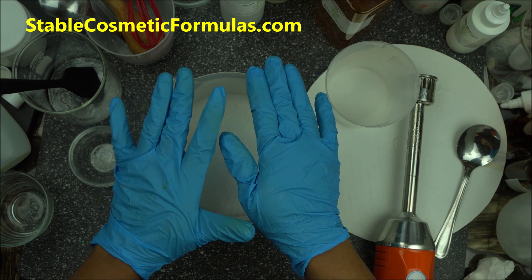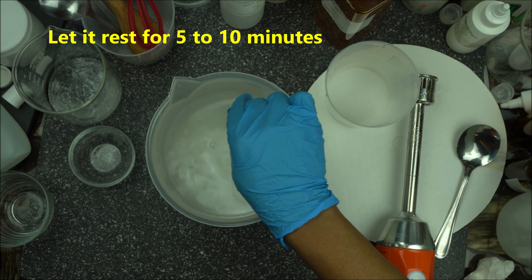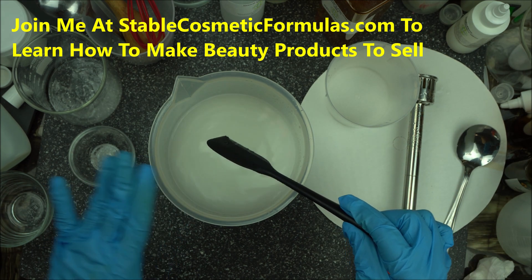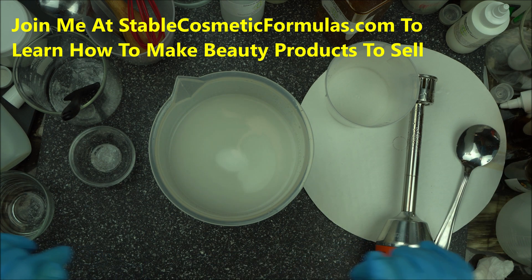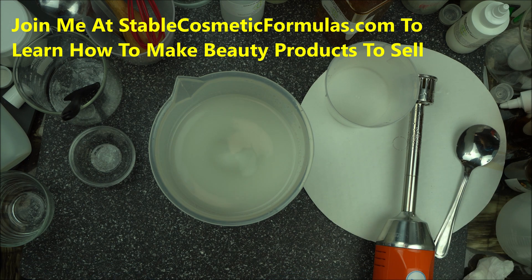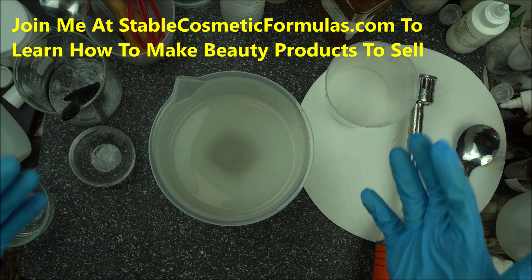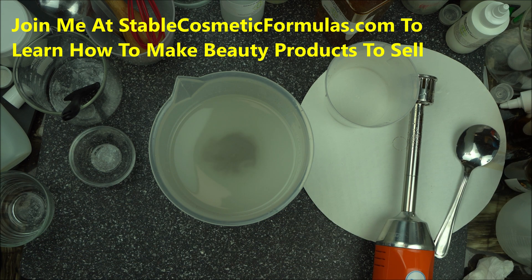After blending, allow it to rest for at least five to ten minutes, then blend it again. Every five to ten minutes you check it and blend it. After doing it two to three times, your gum is ready. Hydroxyethyl cellulose is different in that it takes time for the molecules to swell up and to be fully hydrated. So it requires a lot of mixing, but using this procedure will make your job a lot easier and speed up the mixing process.